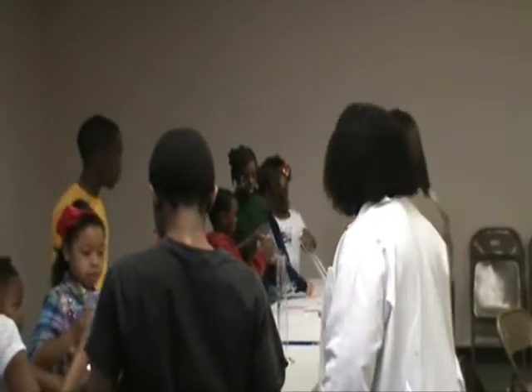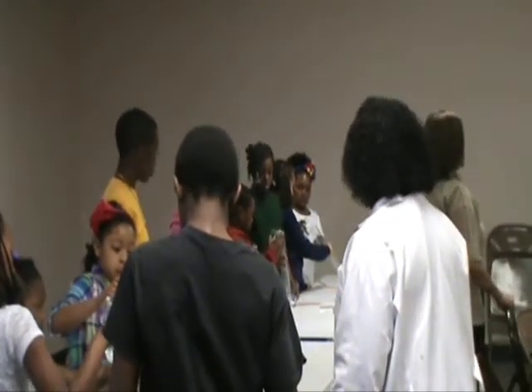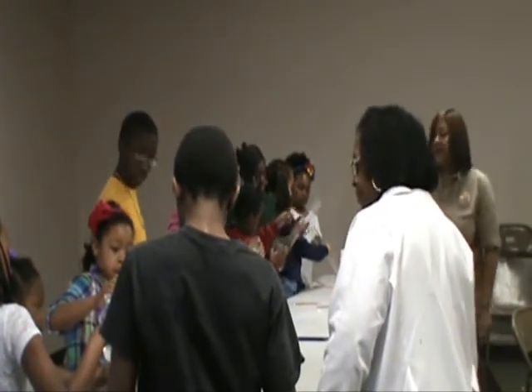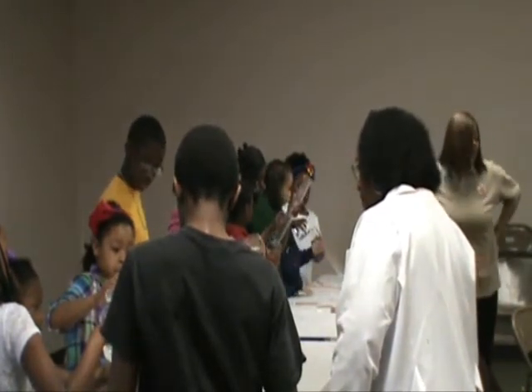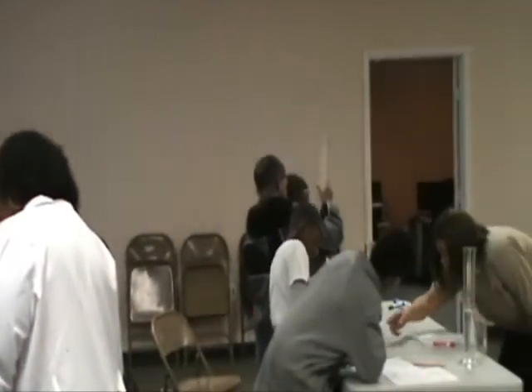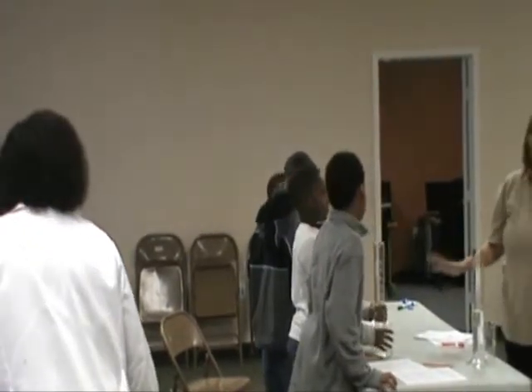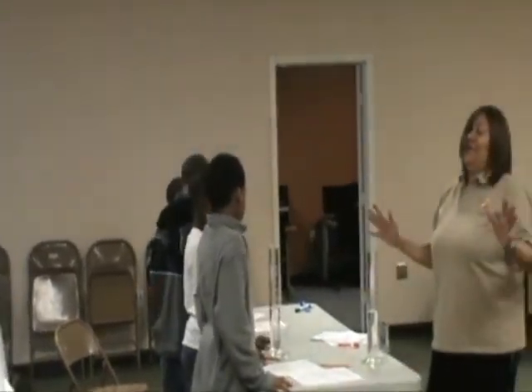I think it would be better for you to hold it. She can help you with the cylinder. What is the amount you're looking for? Do y'all remember? We're going to 250. Excellent. Do not go to the top. Go about 240. Give me about 245. If you pour about 245, that's perfect. Let me see. Oh my gosh, you won't believe this. He poured a perfect 250, including the meniscus.